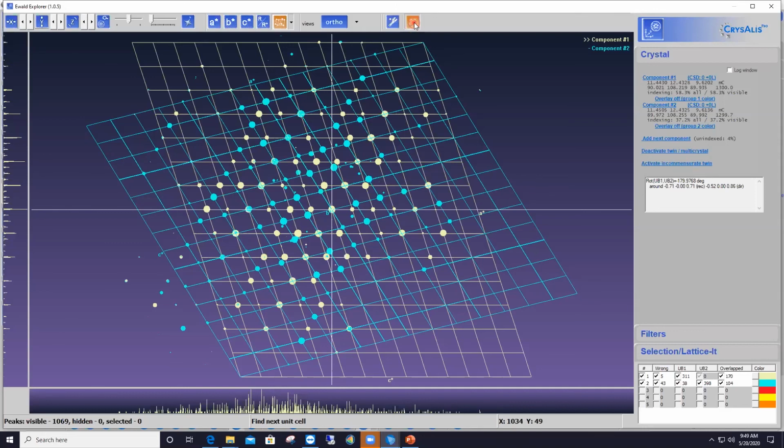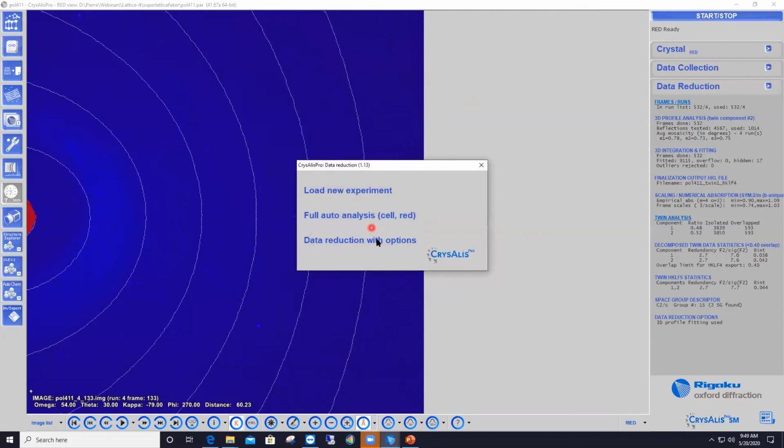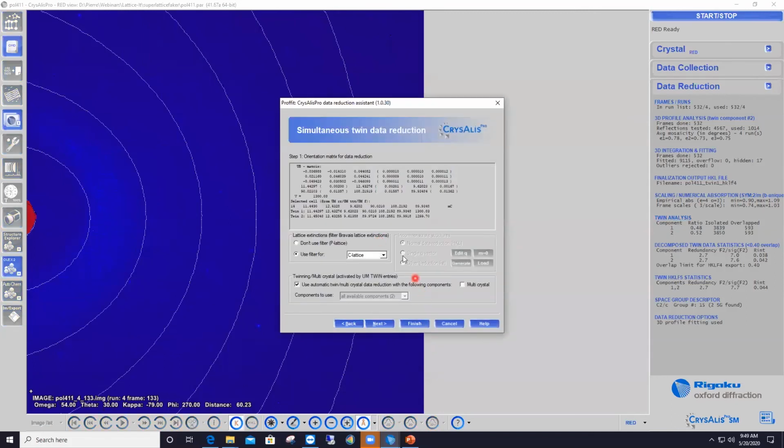And once you've done that, and you go to your data reduction dialog by going to start, stop, and data reduction with options, this feature here that is completely grayed out says incommensurate structures. This will be automatically enabled if you index your diffraction pattern with the incommensurate structure enabled. And so at this point, you just go on with processing the data set with the proper Q vectors, and CrysAlisPro will generate for you the proper reflection file. Now, that's where we stop though.